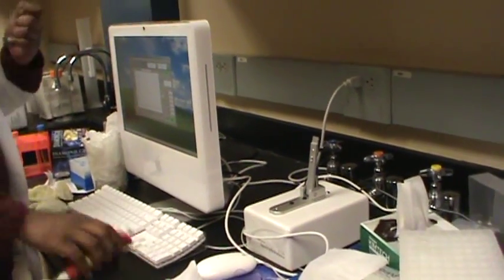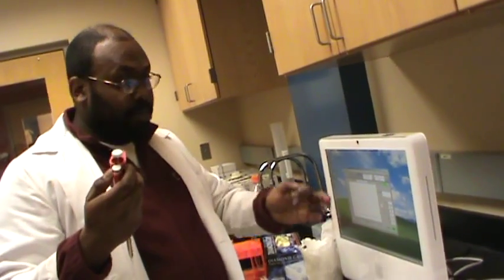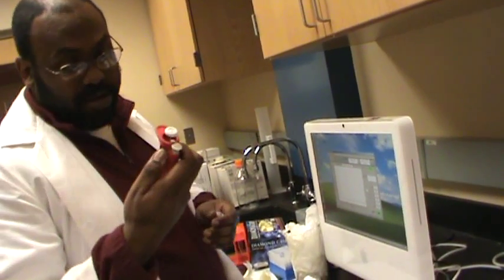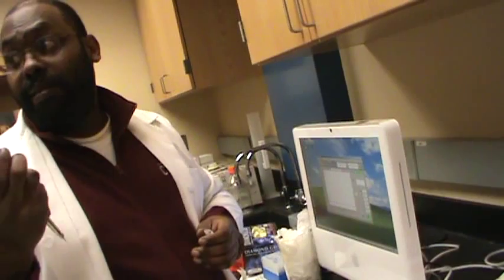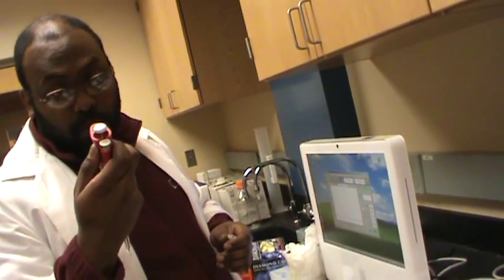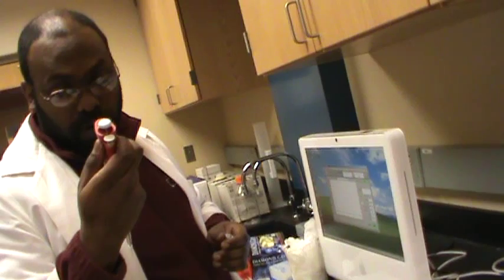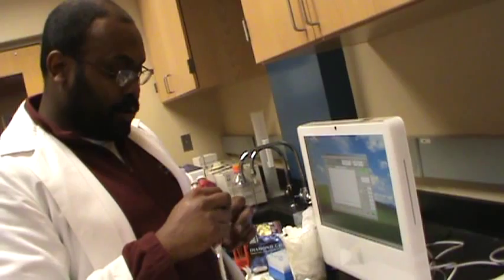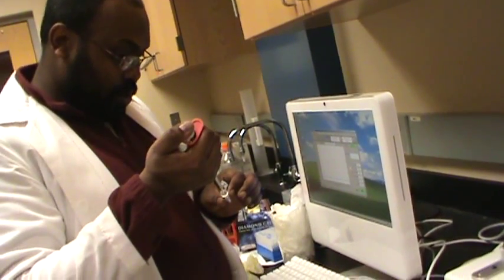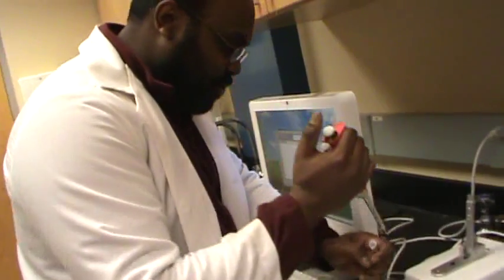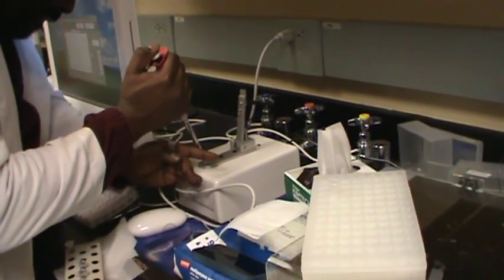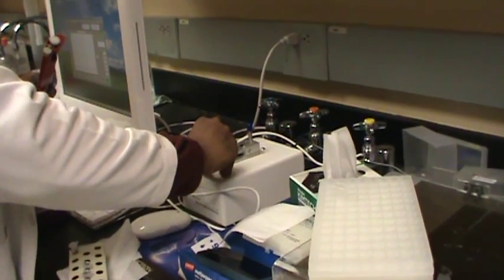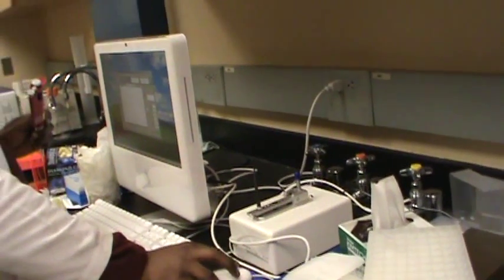First we have to blank the sample. The sample has no DNA, right? So we have to put a blank. All you need is a microliter of whatever your DNA is in. Your DNA is in water, right? So we need a microliter of water to blank it, the same water that was used to elute the DNA. So one microliter of water.